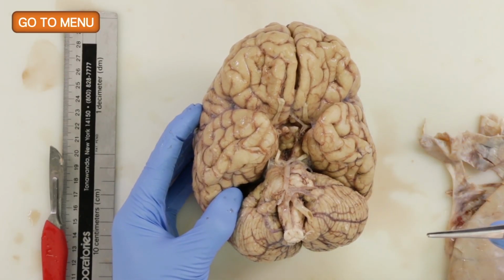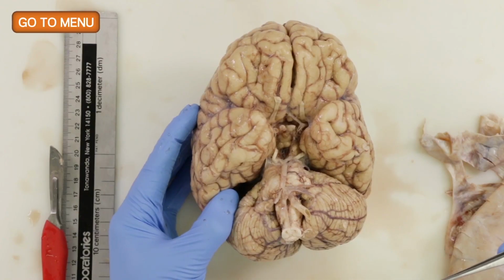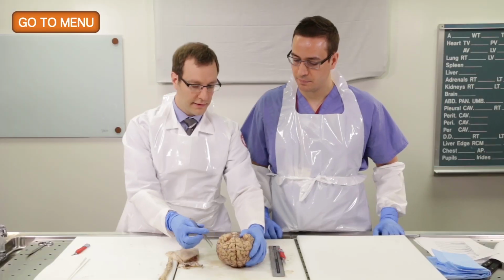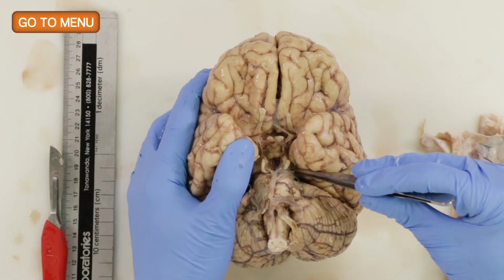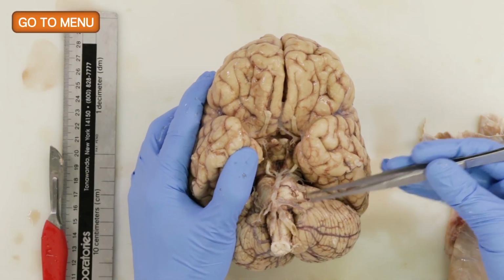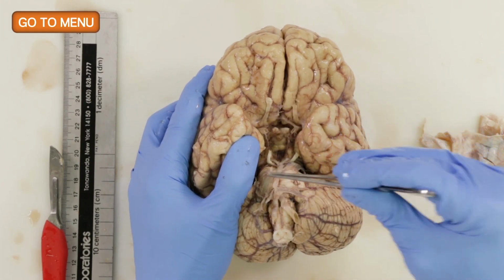So we want to take a look at the circle of Willis for evidence of atherosclerosis, evidence of what else would you look for in the circle of Willis? You should also look for evidence of aneurysms, like a berry aneurysm involving the communicating arteries. Right, so if you are going to have an aneurysm in the brain, frequently it will be involving the circle of Willis. More typically the anterior aspect of the circulation than the posterior.